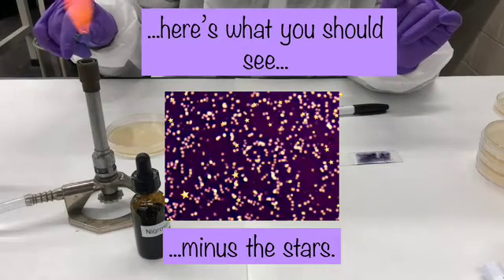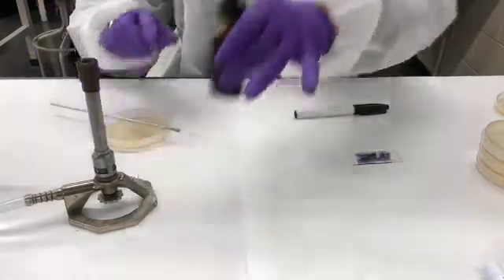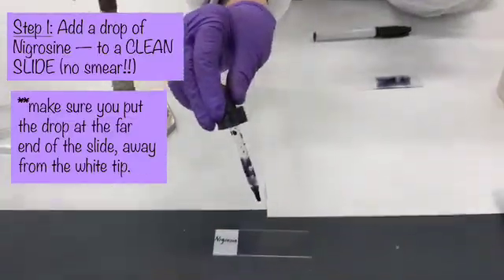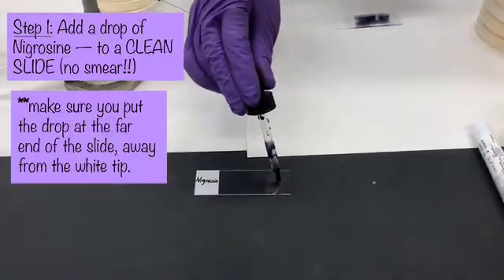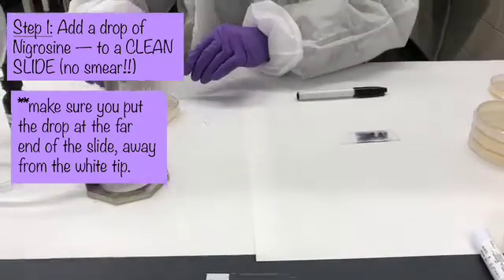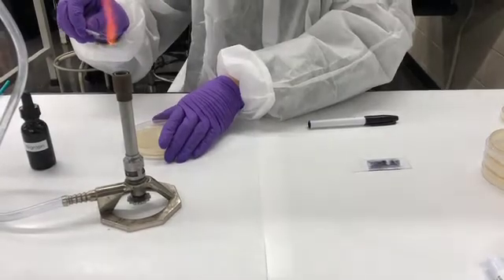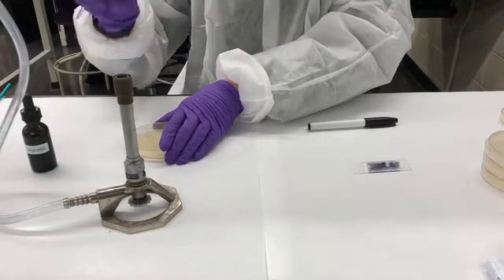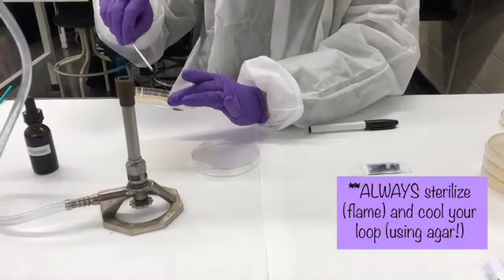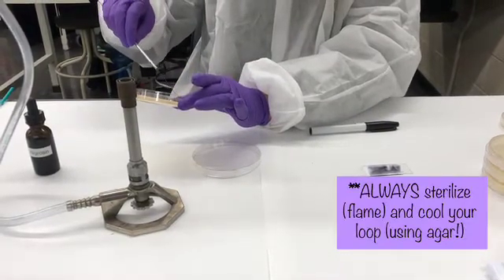To conduct this technique, we're going to first add a drop of nigrosine to the microscope slide — we're not doing a thick smear. We will sterilize our loop, cool it on an area where there's no bacterial growth, and then add one colony.